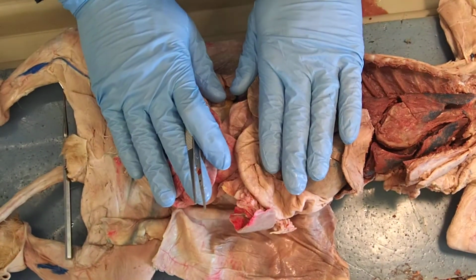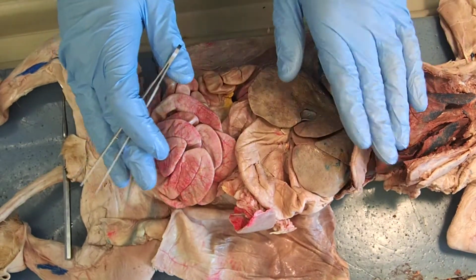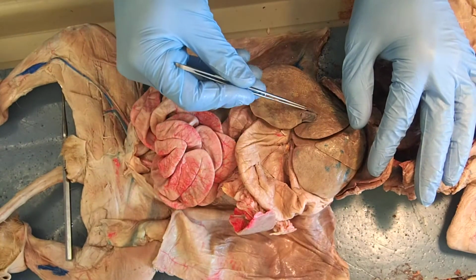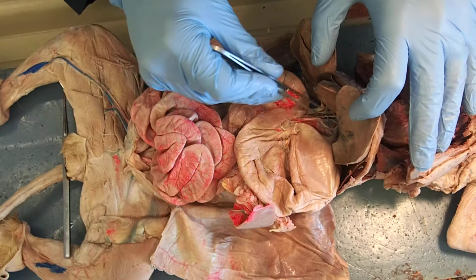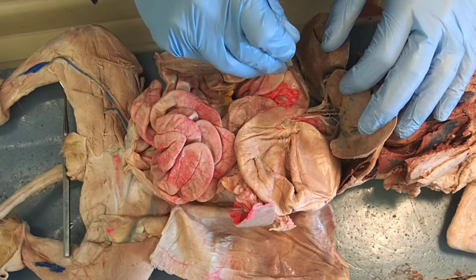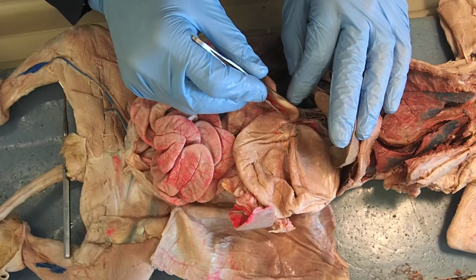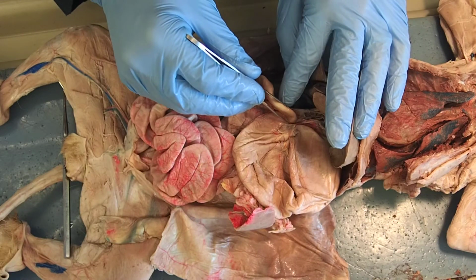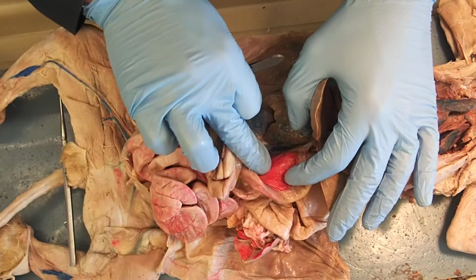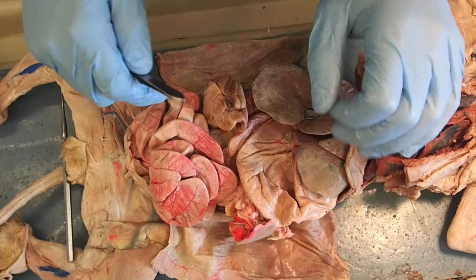So that should cover everything. Feel free to go back through this slowly and draw everything out, the pathway of things as they go through. All right? We had the liver, we had the gallbladder, we had the hepatic ducts emptying into the common bile duct, same with the cystic duct coming from the gallbladder, entering into the duodenum via the hepatopancreatic ampulla. You have the pancreas in the back here. That's also releasing digestive enzymes via the hepatopancreatic ampulla.